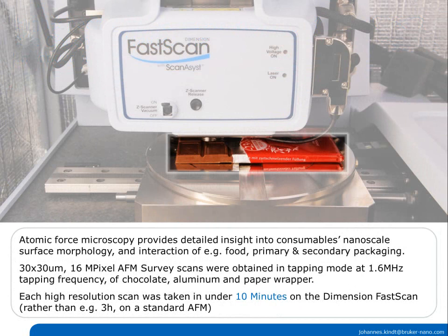Imaging the surface of chocolate can be rewarding in a demo. You can image one piece while sharing the rest with the customer. Sample prep. None really required. Break off a piece of chocolate, make sure to image one of the higher areas, for example the raised frame on this Lindt chocolate. Try to image an untouched area. For optimal stability, you can mount the chocolate piece on a glass slide.